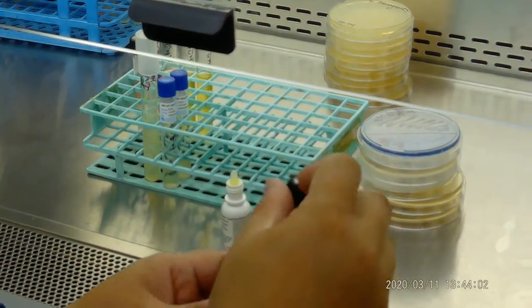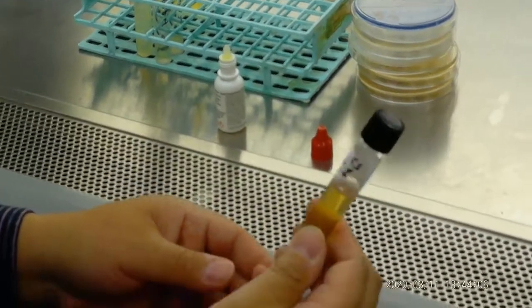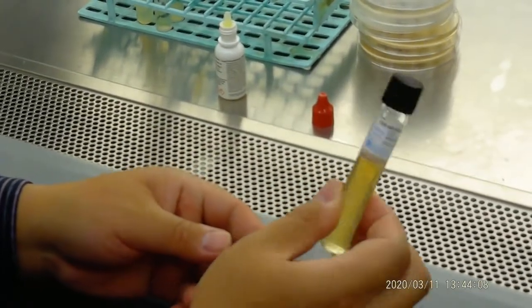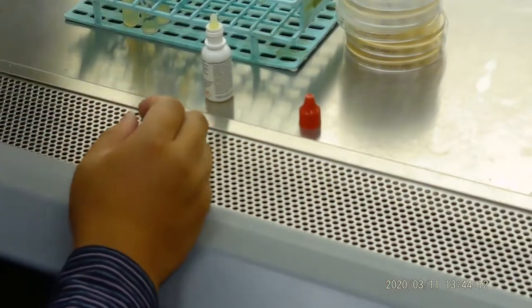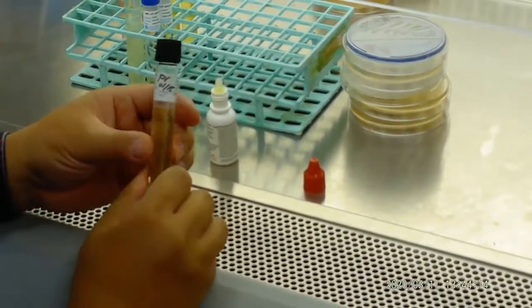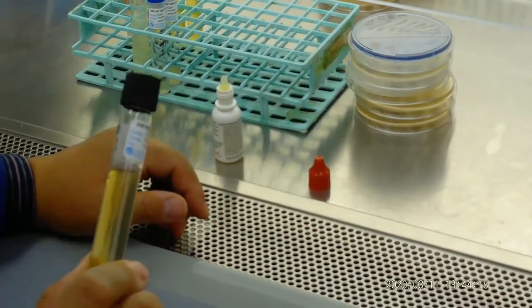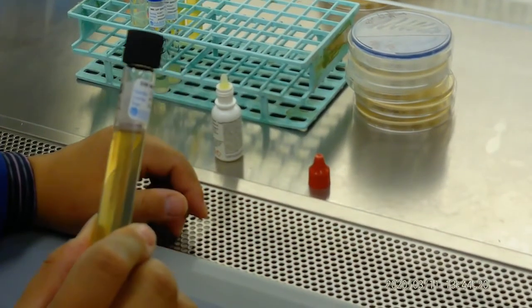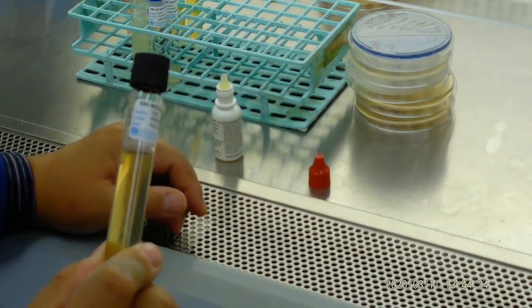We also see it's red here, but actually it's not correct. This means this Pseudomonas aeruginosa, this Proteus vulgaris, might be contaminated, so we don't know the reason for that. Okay, so you can take a picture right here. We didn't see much of the color.